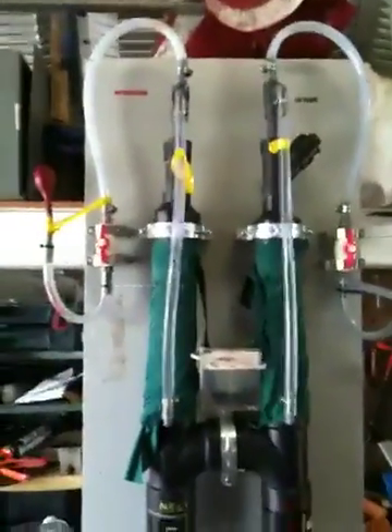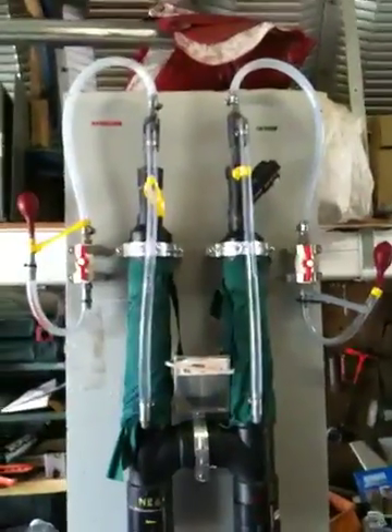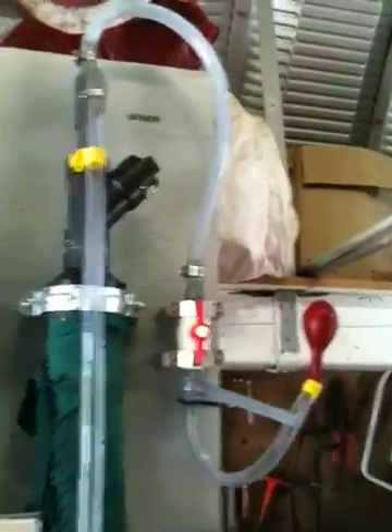Basically I'm making hydrogen at a two-to-one rate. We'll see how good the process works here as it starts to develop a bit of internal pressure. You can see the hydrogen bubbling through. That balloon will increase and become lighter than air. That oxygen there is a good, reactive, pure gas.